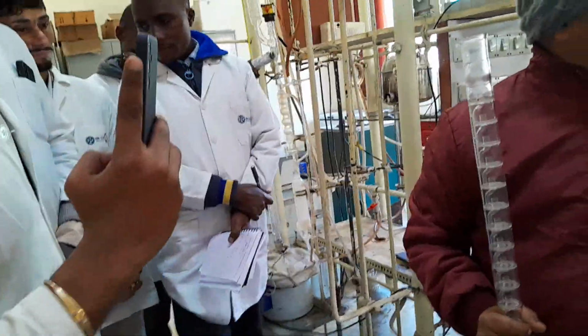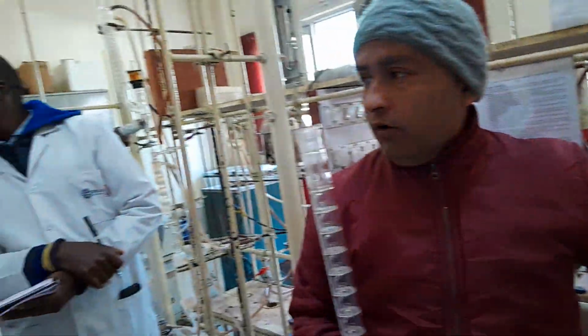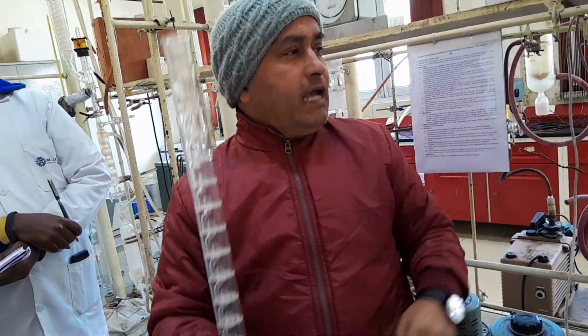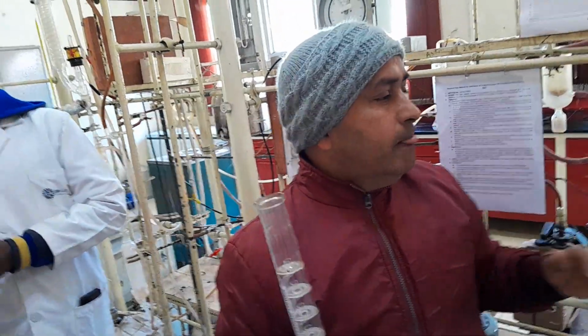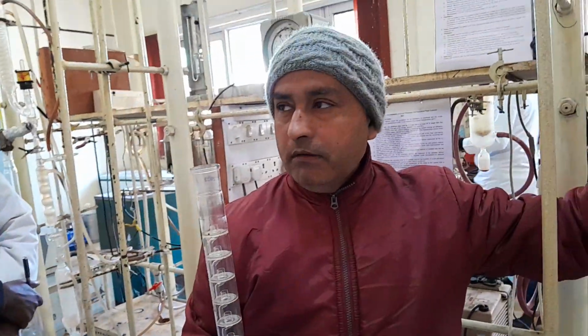And the silver coating you can see over here. This is silver coating. Okay, I will let you know everything. So this is the inside, evacuated. It is holding the pressure of 10 to the power minus 6 mmHg. Why is it there? Because there should not be any heat loss during the distillation process.